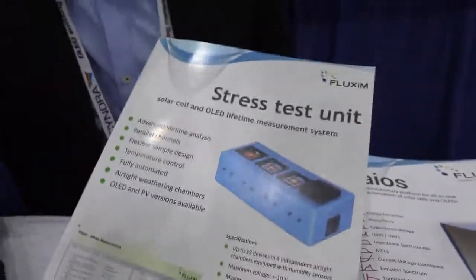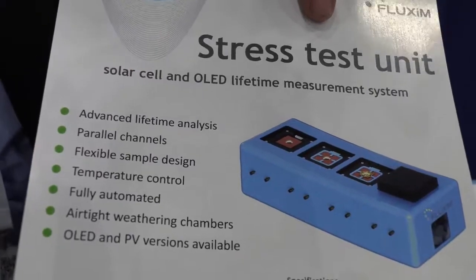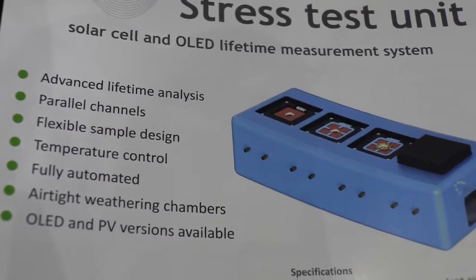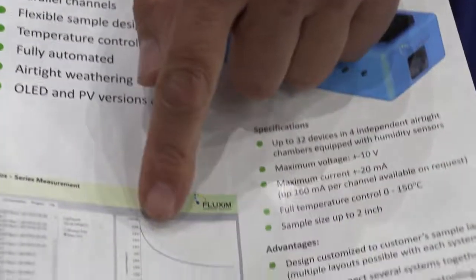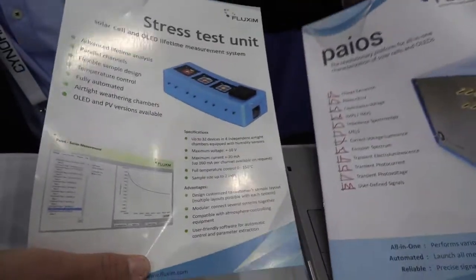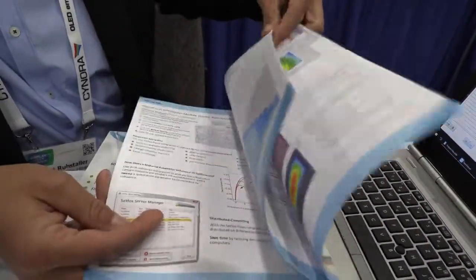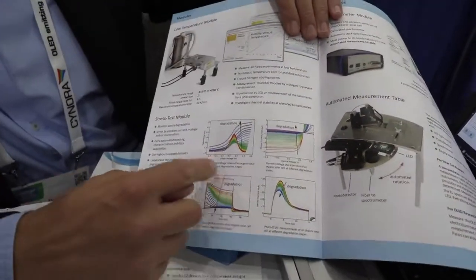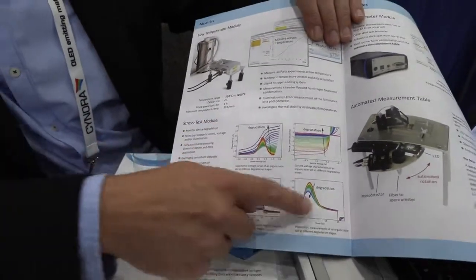We already have something in the pipeline, which is an extension. We also want to help people analyze the degradation phenomena that still occur. So this is a stress test system that can do accelerated lifetime testing at higher current density and higher temperatures. We have 4 different temperatures here in these stages. Multi-channel stressing can be done here, to monitor the decay of the performance of the OLEDs. And then we want to combine it. The customer can do this in combination with this other instrument. Every 15 minutes after stressing, we would remeasure the device performance, and we already have some examples here. You see that there's a systematic change from a fresh to a degraded device, and by doing more than this simple decay curve, the customer can understand why his OLED device is degrading.